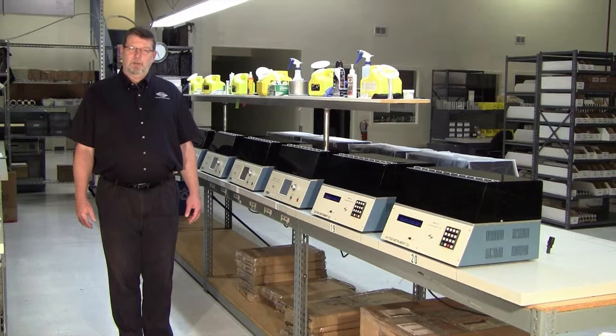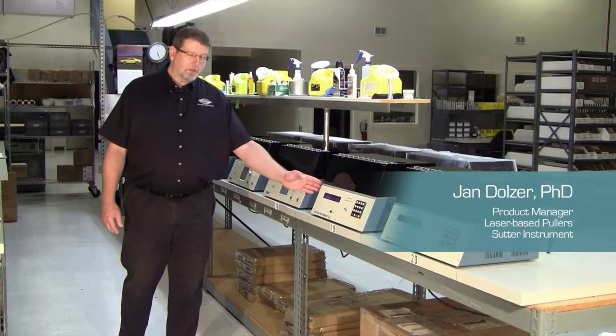Hello, this is Jan Dolzer at Sutter Instrument. This is a short tutorial about checking the pull cable adjustment on your Sutter P97, P1000, or P2000 puller.